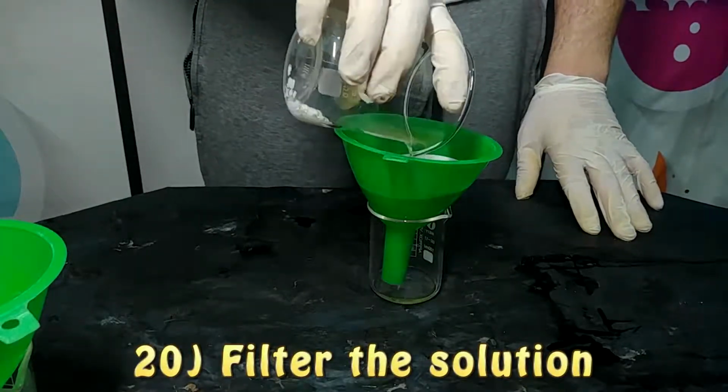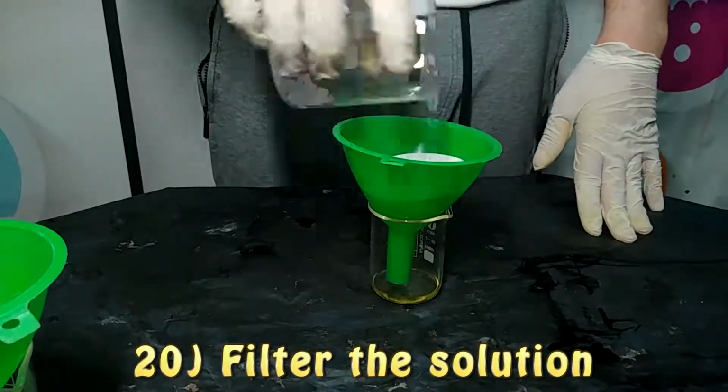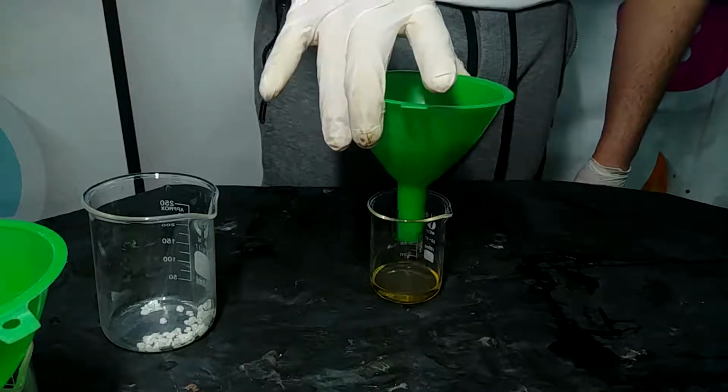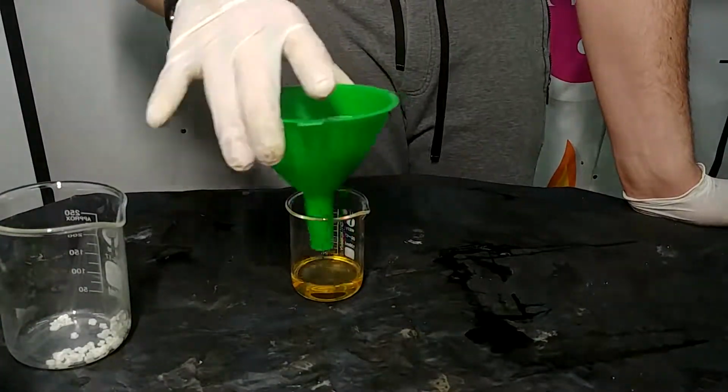So the last thing that we have to do is to filter this DCM containing calcium chloride in order to remove the latter. And you can simply use the sieve or, if you wish, a filtration paper.